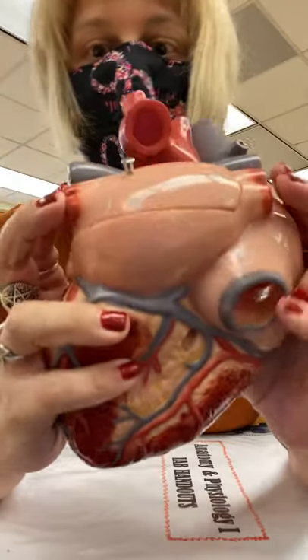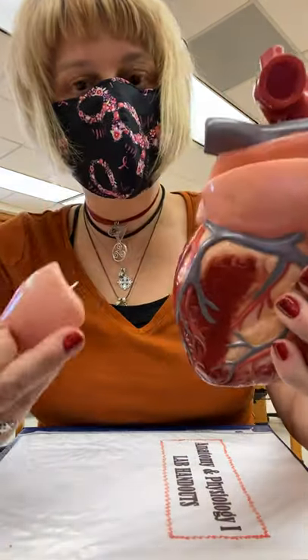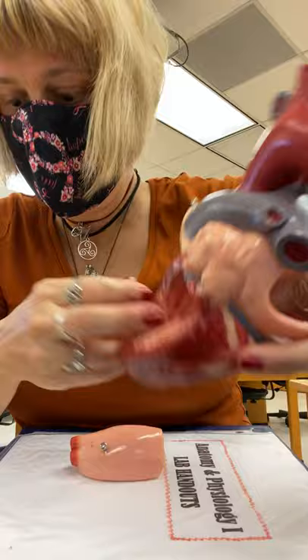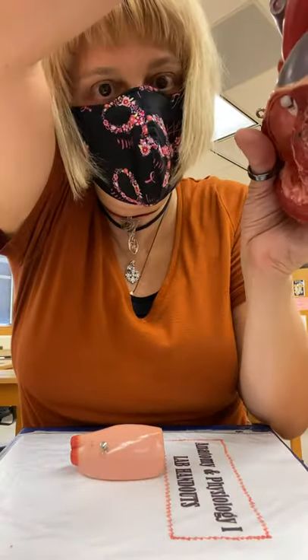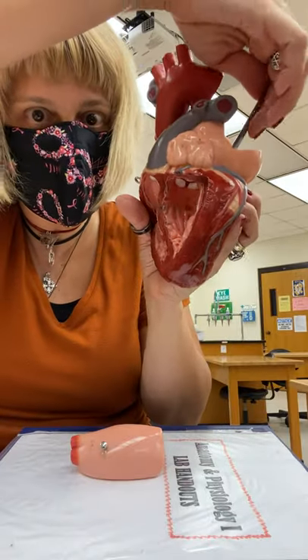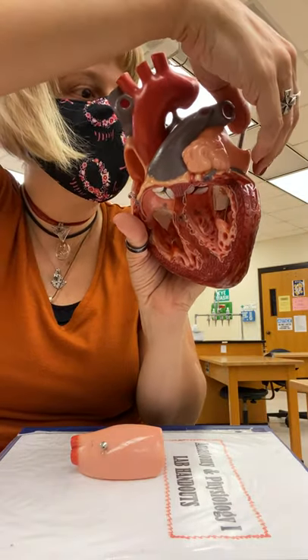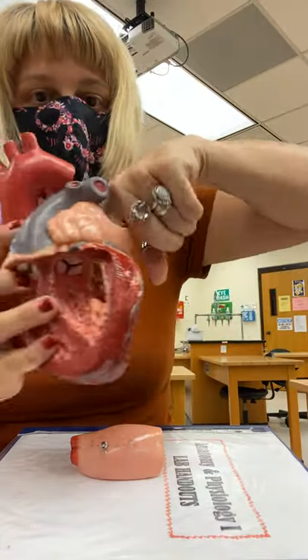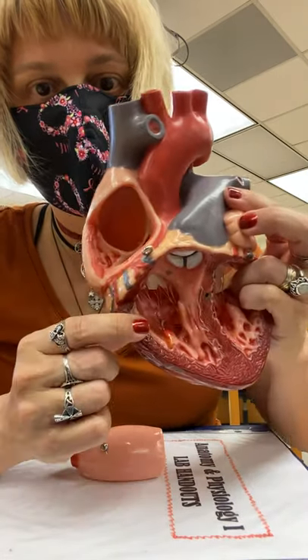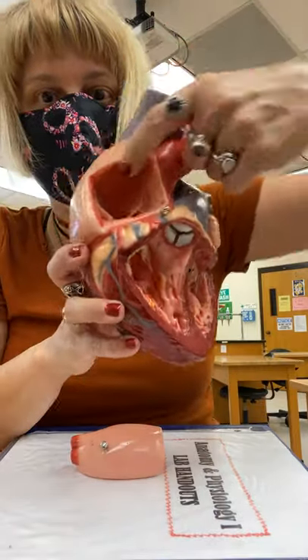If I turn the heart around back here, you have two pulmonary veins from the right lung and two pulmonary veins from the left lung, coming back into the left atrium. That would go through here — left atrium into left ventricle. How do I know it's left? Because of the muscles here. Now look at the right side — much thinner. The inferior vena cava and superior vena cava feed into that right atrium.